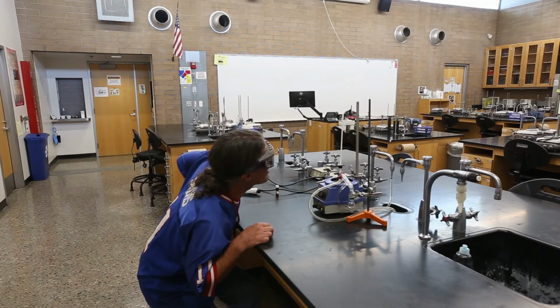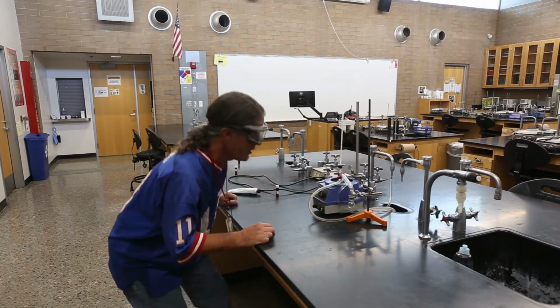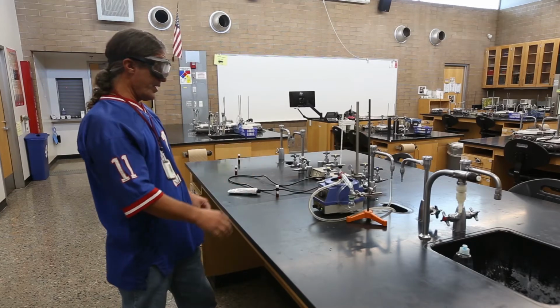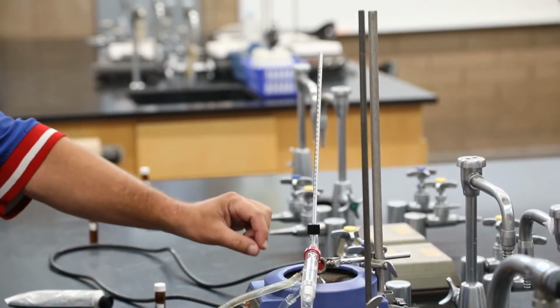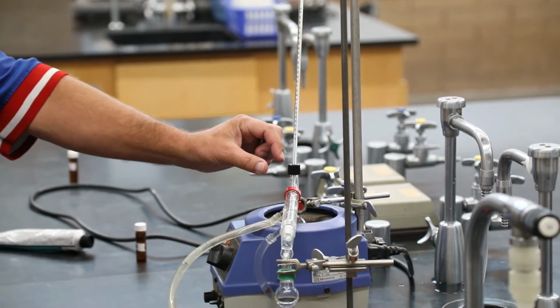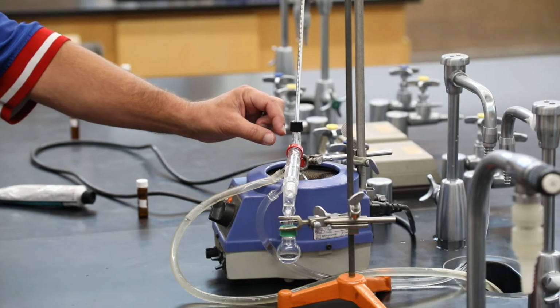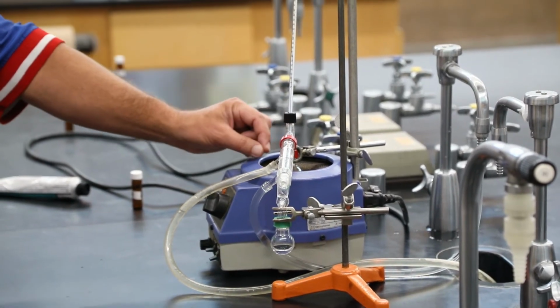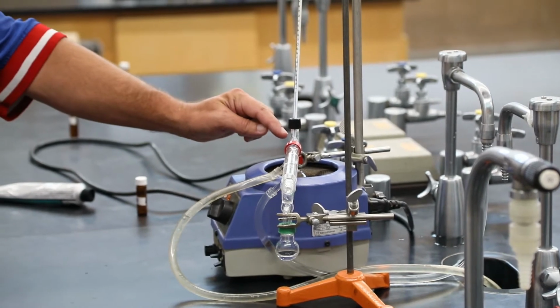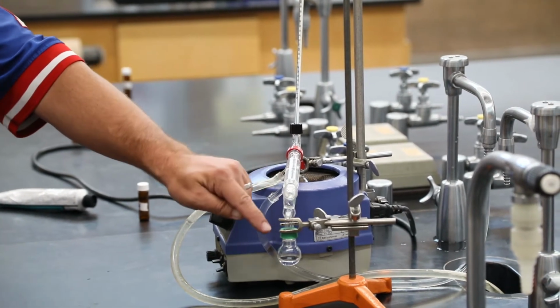Again, I'm going to record the temperature about every 20 drops, so we're still at 66 degrees. And it's weird because we're putting so much heat into this, we would expect the temperature to go up, but all the heat is doing is vaporizing the substance and not increasing the temperature, because vaporizing it takes energy. It vaporizes and condenses at the same temperature, 66 degrees right now, and then it condenses over here as well, and that's where we're collecting it.